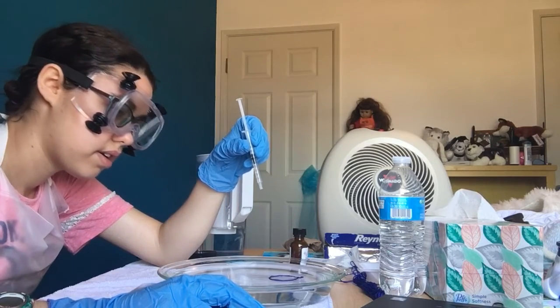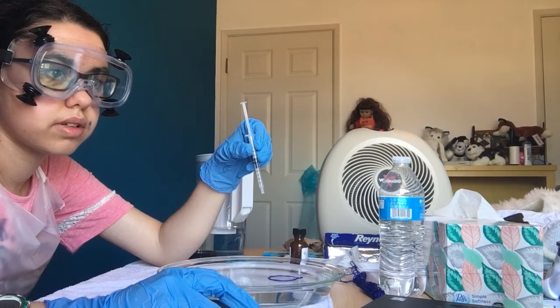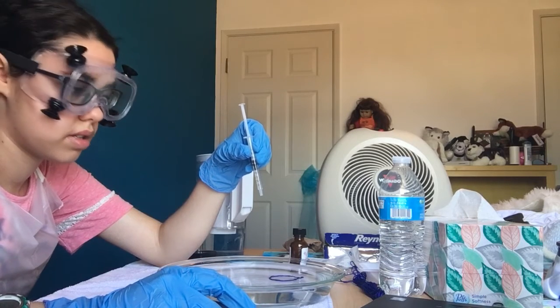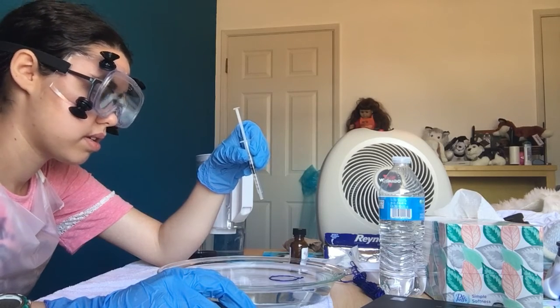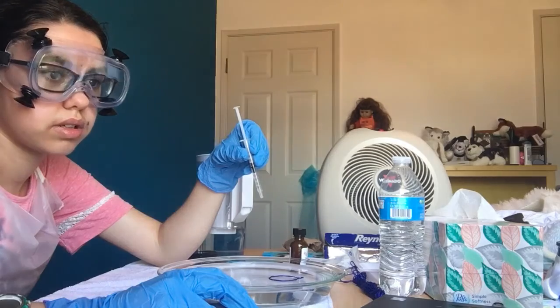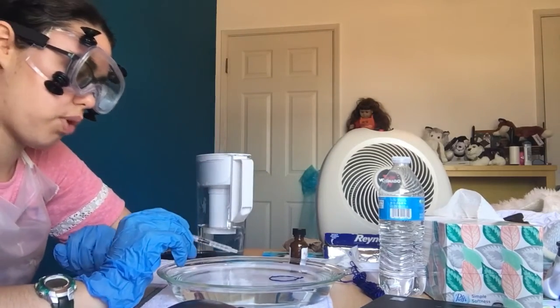Huh. Interesting. So I think it's formed the circle now.